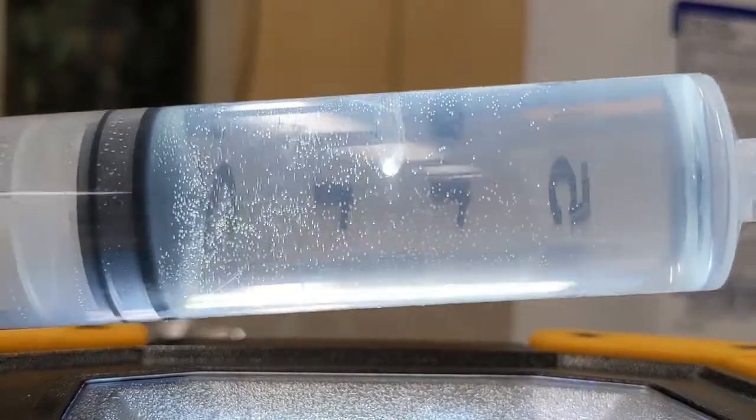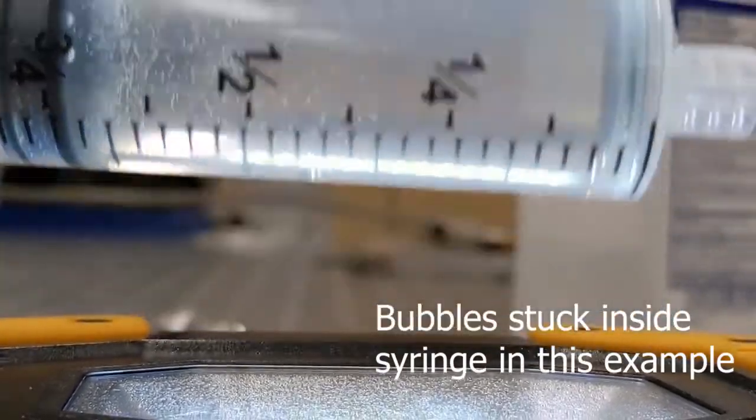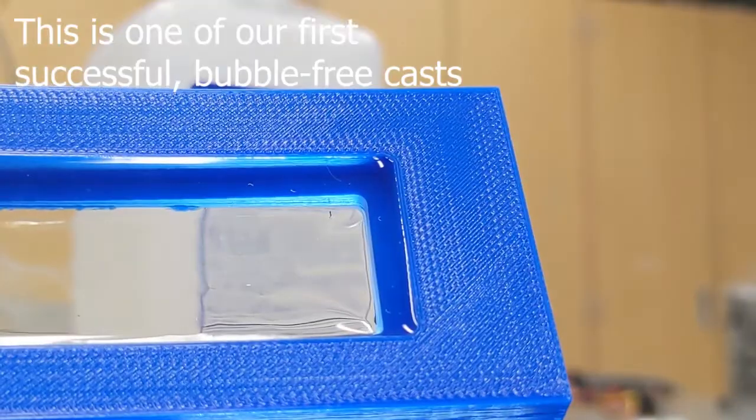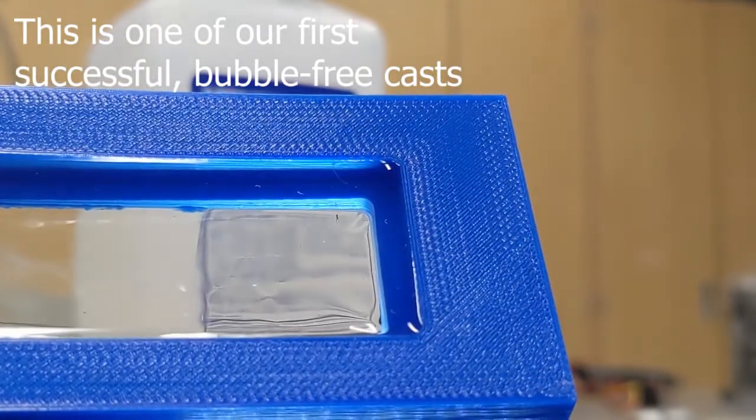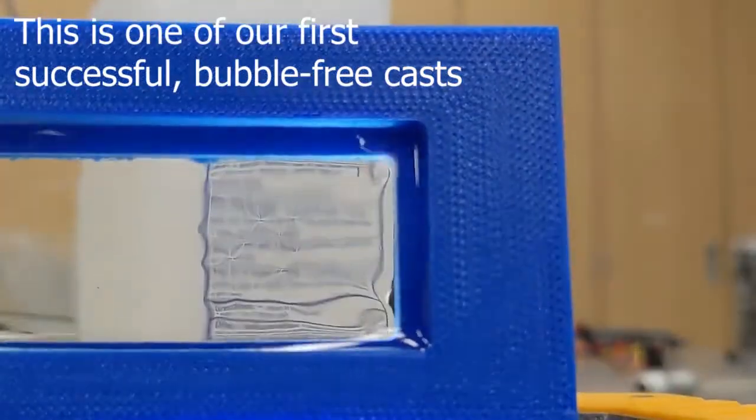What's up guys, my name is Fernando and today we're gonna talk about those tiny pesky little bubbles that appear when you're trying to cast transparent epoxy resin. We're trying to cast the transparent part for one of our experiments, and these bubbles are really hard to get rid of. Because the epoxy resin is very viscous, they take a really long time to rise, much longer than the cure time, and they end up frozen inside the resin.